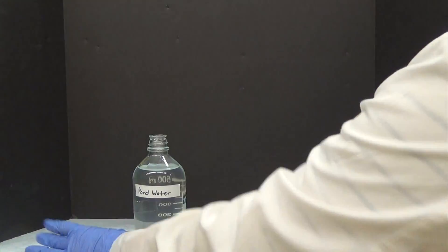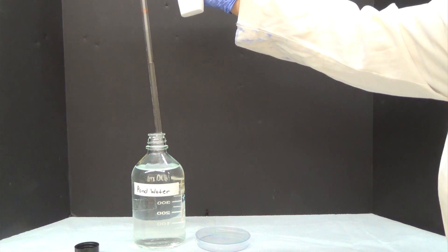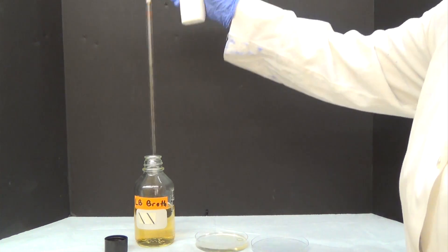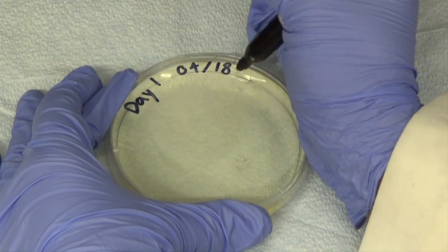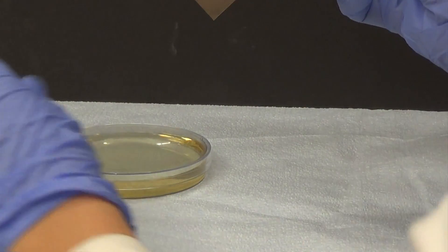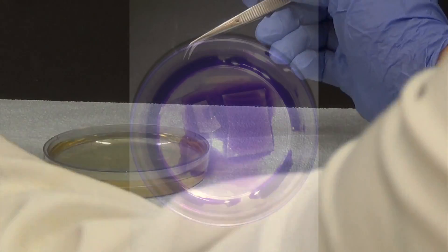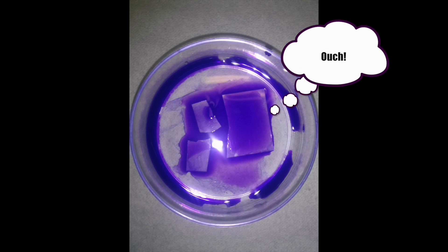The source of bacteria will come from a sample of pond water. To start your experiment, you will add 25ml of pond water and 25ml of LB broth to a sterile 100mm petri dish. You will use a new dish for each day of sampling. Each petri dish should be labeled by date. Four cover slips should be added to each petri dish with sterile forceps. Make sure they are completely covered by liquid and that they are not overlapping.